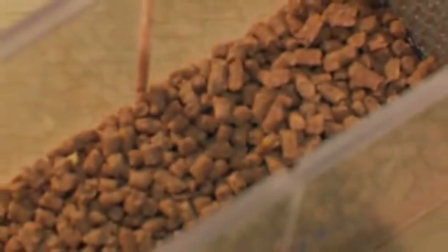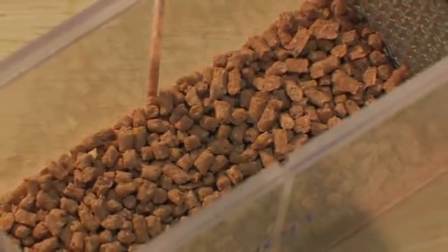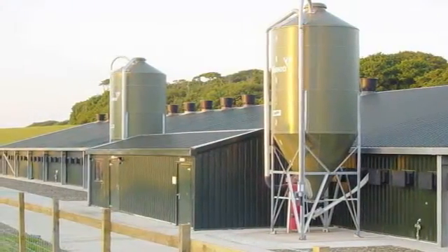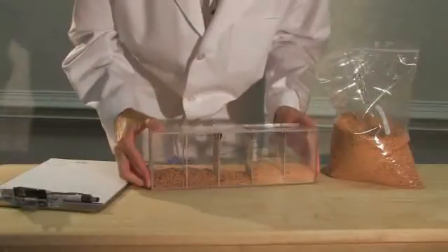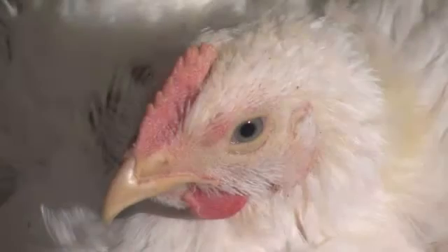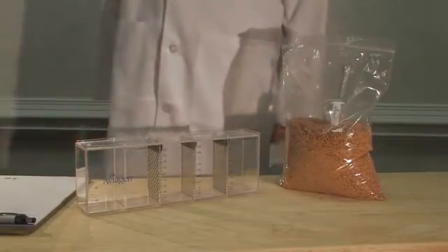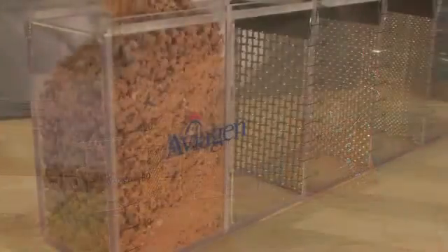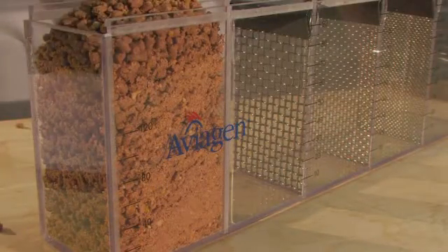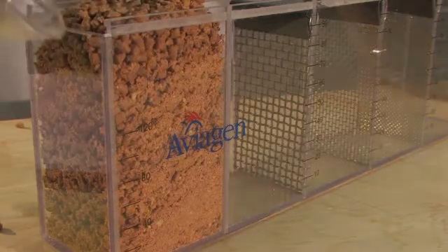The impact of feed physical quality on the performance of the modern broiler is well known in the industry. It is of vital importance to promote the use of feeds of good physical quality in the field. This is practically assessed by the size distribution of the feed particles presented to the birds. Recently, the global nutrition team at Aviagen developed the Shaker sieve as a method for demonstrating the particle size distribution of feed in a straightforward and easily observed manner.